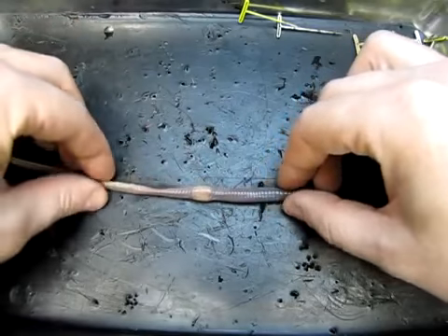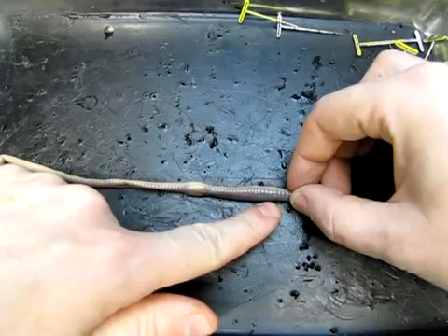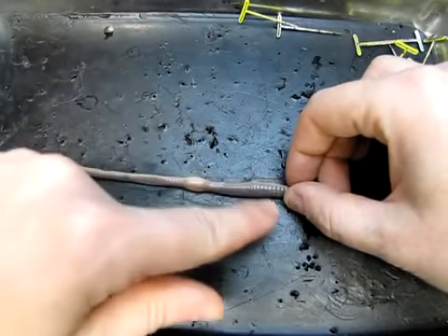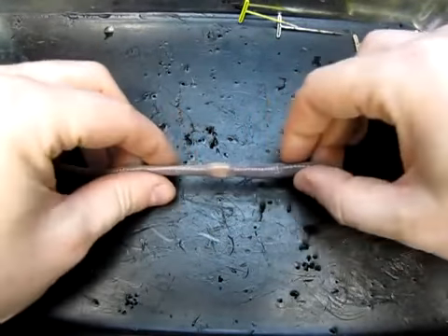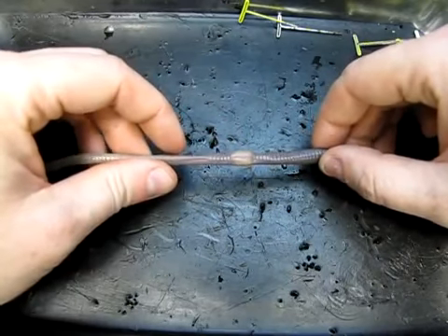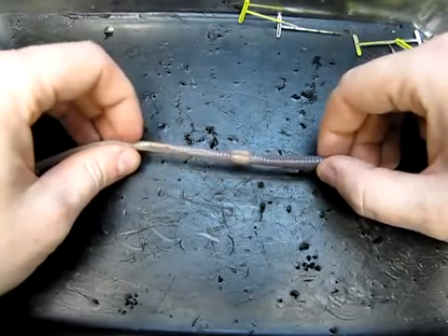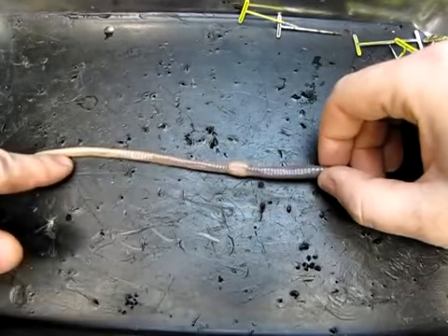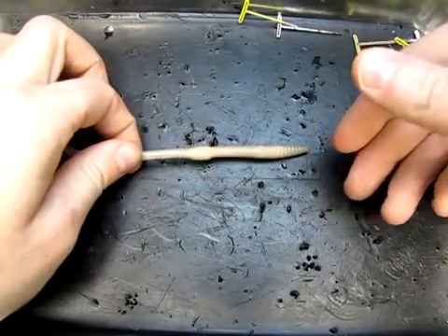The other thing we might notice, and it might be a little tricky to see on this video, but we'll try. Running along the dorsal surface, you may see this area where there is a slightly darker sort of line running down, and it goes the entire length of the body. That is actually the dorsal vessel, the main blood vessel, that is just showing through the skin essentially, but it's actually lying just above the intestine inside, and we'll see it later. But that's the dorsal vessel running the length of the body. So that may be another good indicator for you if you're looking at the dorsal side or the ventral side.